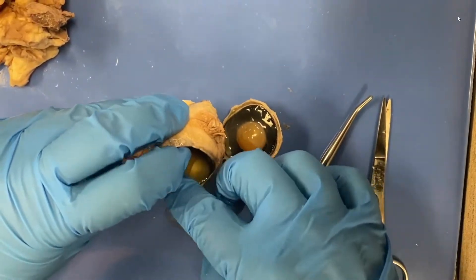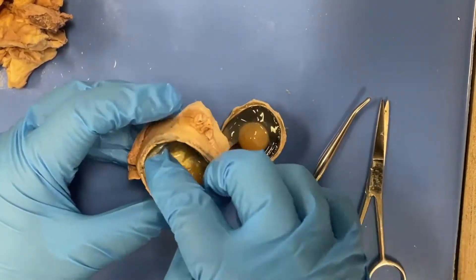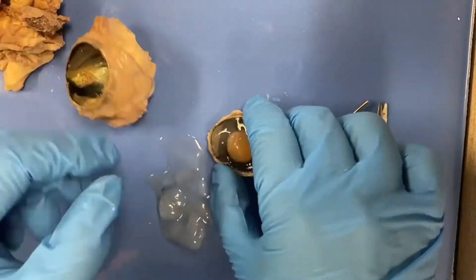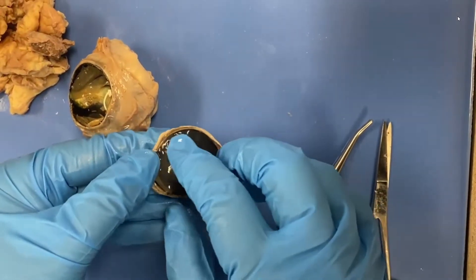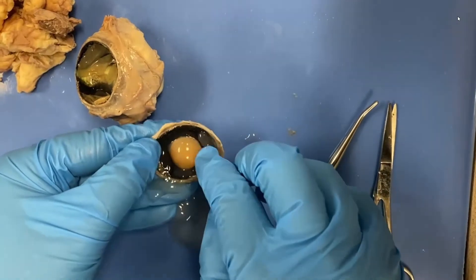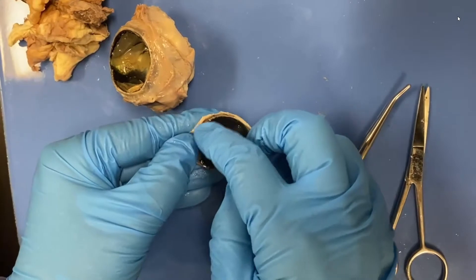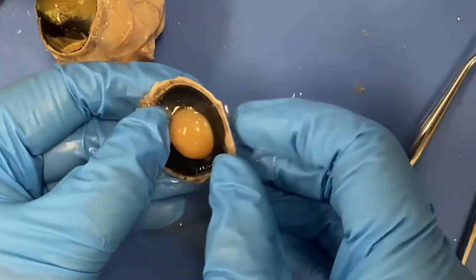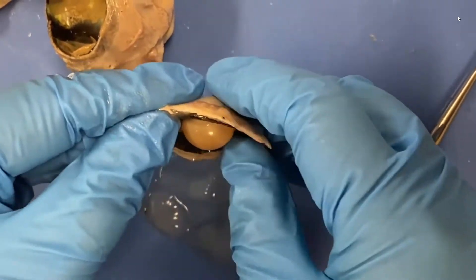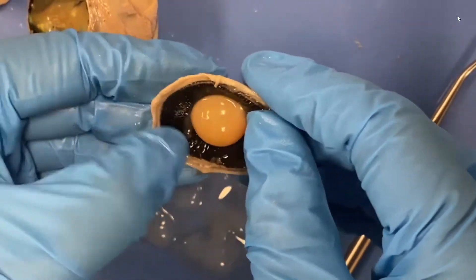We're going to take that out because it's interfering with what we're going to look at next. We'll come back to this posterior cavity in a little bit. So let's go back over here to the anterior cavity. If we can take off some of that vitreous humor, we can look at the posterior surface of the lens. Some of that may be water from the anterior cavity, and that water is the aqueous humor, which sits in the anterior cavity.